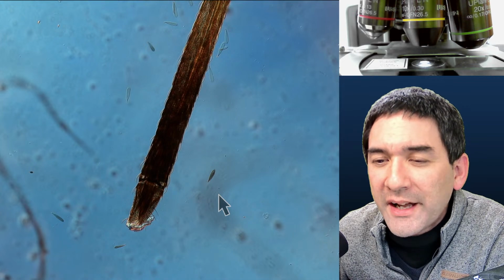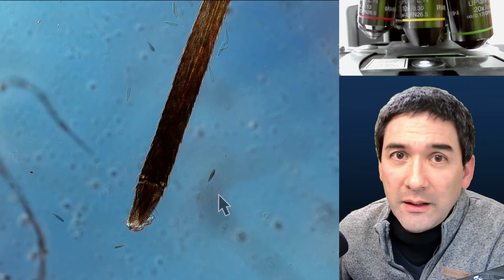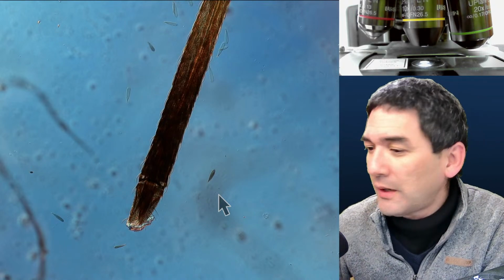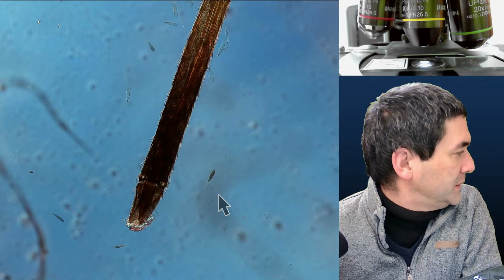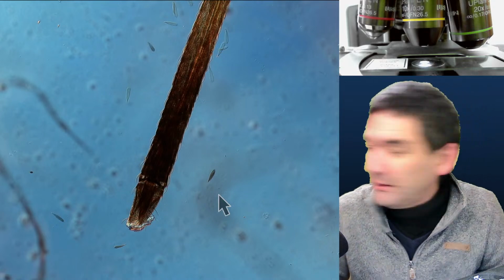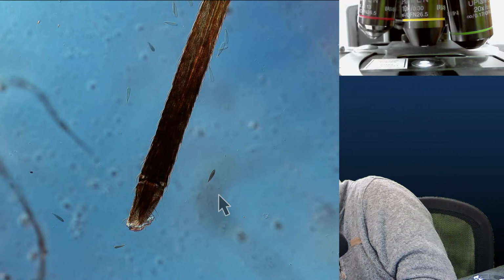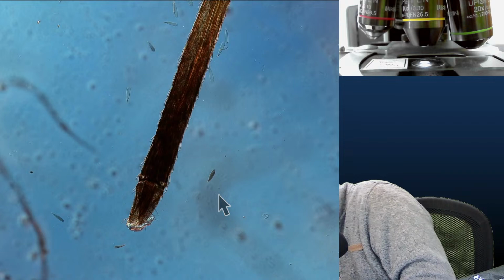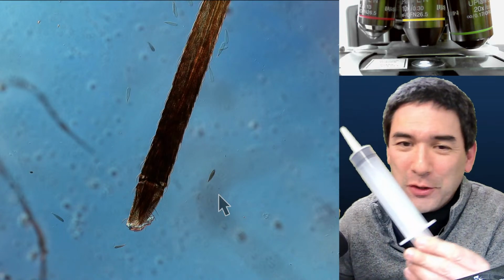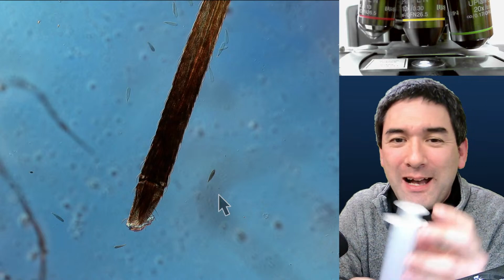How do compound eyes work? Well, basically, it's a different way. I don't have a model here right now, maybe we're going to use some kind of tube or something. Look at this, it's a syringe. Just imagine the following.